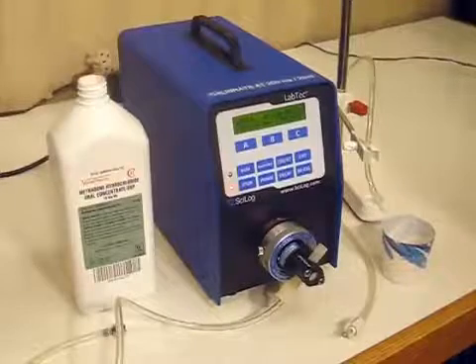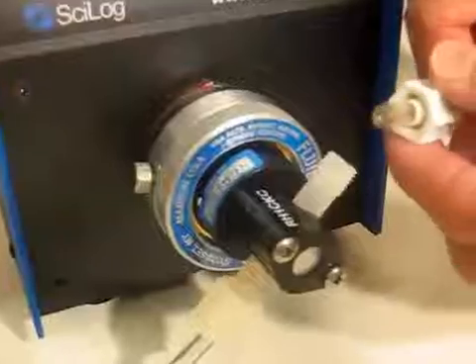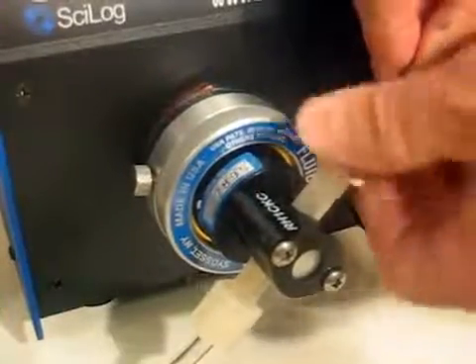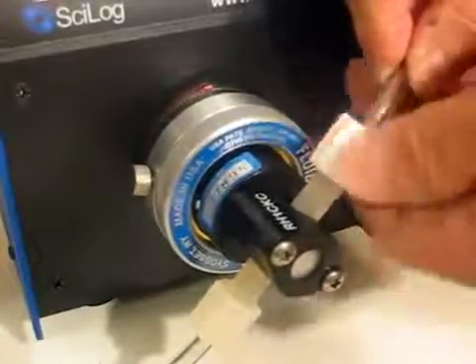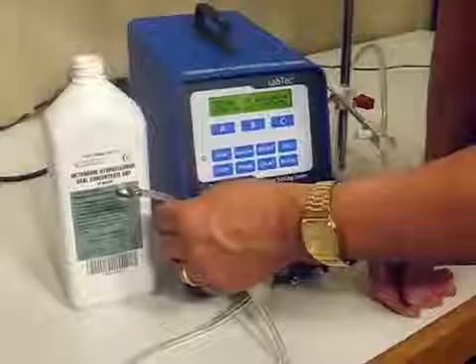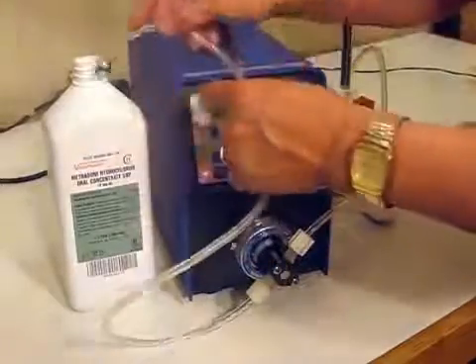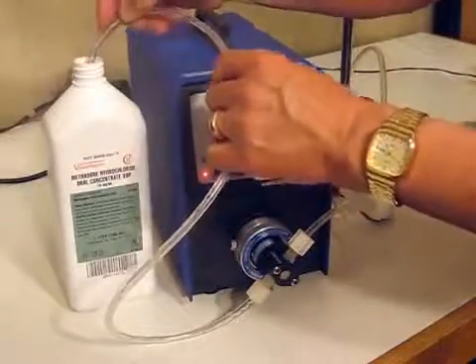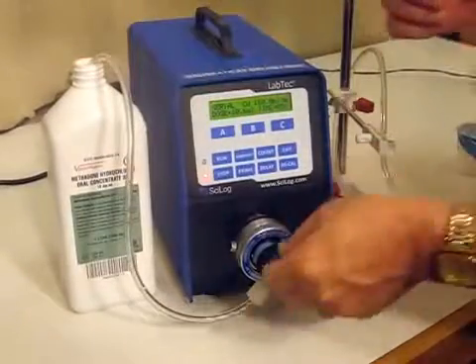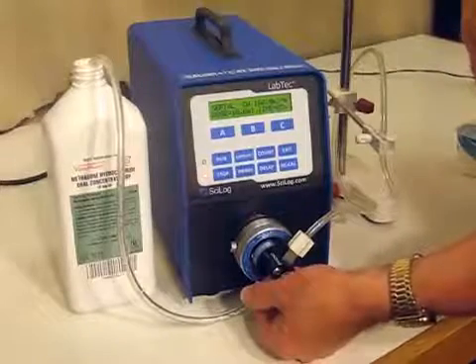Now that the cables are connected, let's move on to connecting the tubing to our piston head. This has a compression fitting on it. This goes inside of the piston head. This screws on. This is the intake side. This tubing has a sinker on the end of it. This then goes into the bottle of methadone. The sinker keeps the tubing at the bottom of the bottle. This is the tubing that is on the intake side of the piston head.